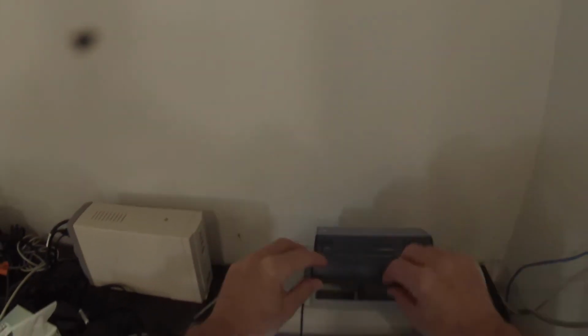4 scans. So this one bottomed out a little bit. I'm not happy with that. I'm going to rotate it a little bit and see if maybe I can get a section of the pellet that's a little bit more clear. I don't really want it to bottom out there. Just putting in the same title.